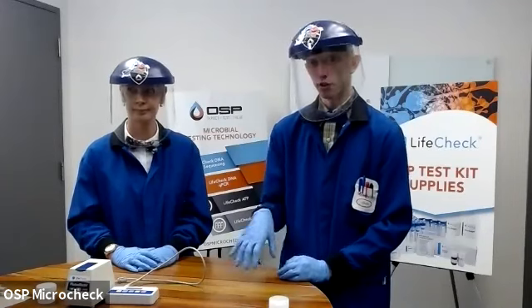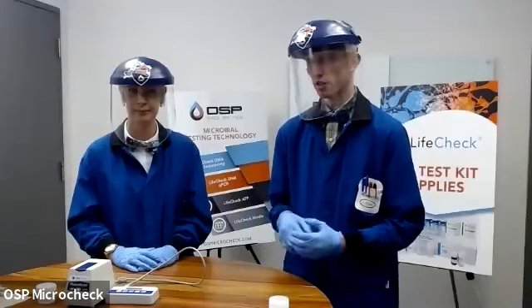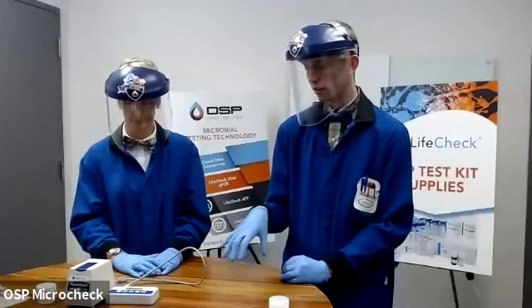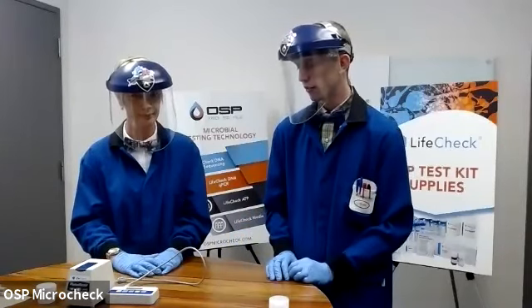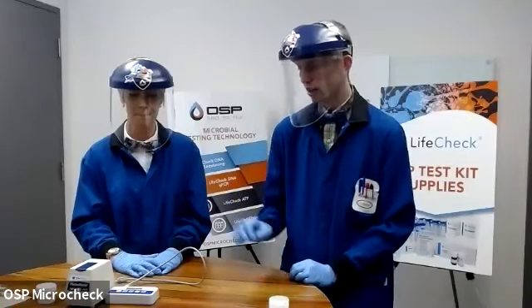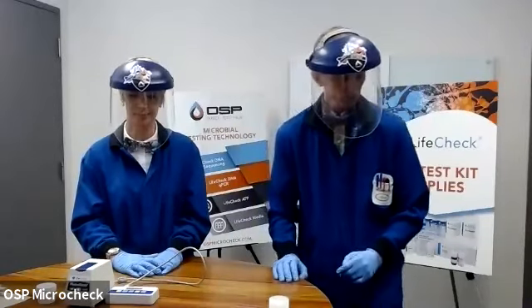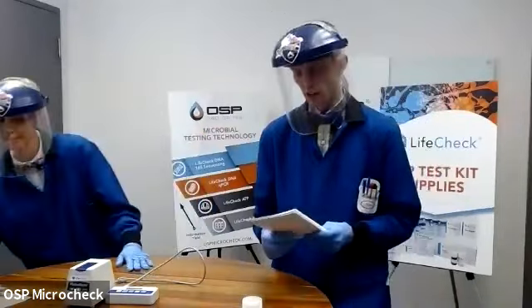I did allude earlier in this webinar that we do have some other methodologies or adaptations that allow you to deal with other sample types. So Virginia and I will go in right now and talk about some of those. We're not going to do full demonstrations of each of them, particularly at the measurement of the ATP steps, because once you get to the extracted ATP point, it's all the same in your interactions with the actual luminometer.